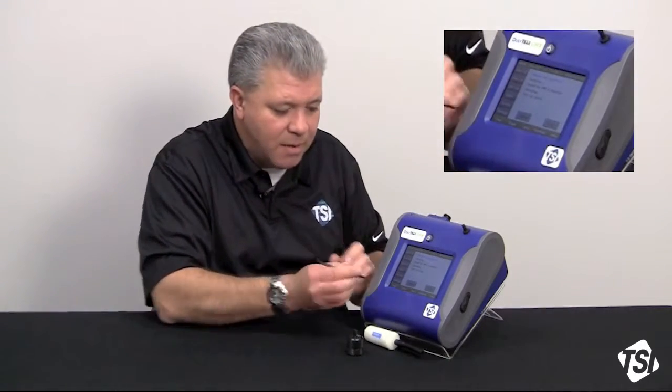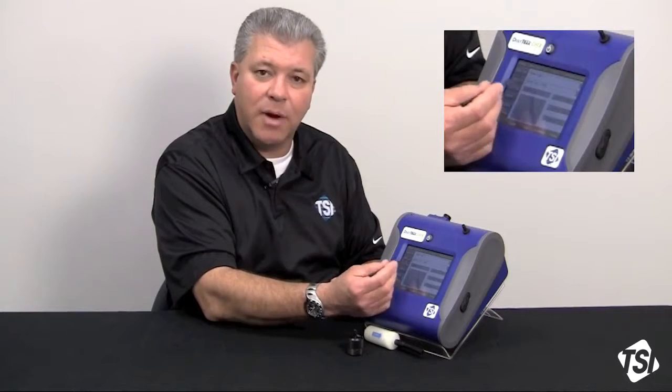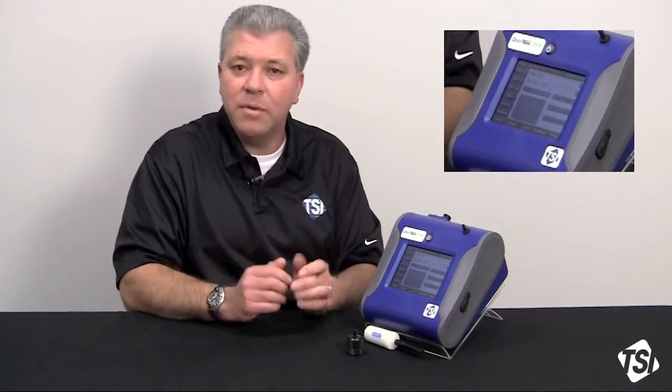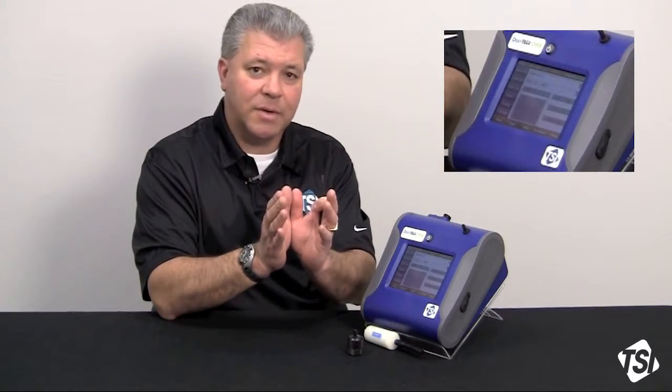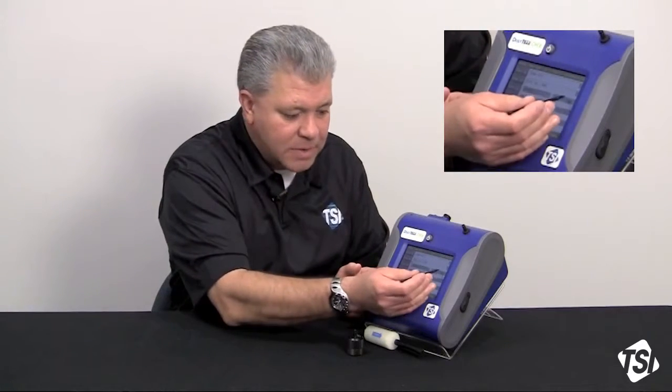When this process is done, you're going to come back to this main screen and instead of 1.0, there's going to be a correction factor put in there. I typically tell people if it's within plus or minus 5% of 1.0, I would just leave the correction factor at 1.0 — you're really not going to change the instrument's response at all. But if that correction factor comes up less than 0.95 or greater than 1.05, meaning you're starting to get a window of difference in accuracy where it's more than a 10% delta, you'd want to accept that information. Let's say your new cal factor came back at 1.40 — you would definitely want to go and accept that.